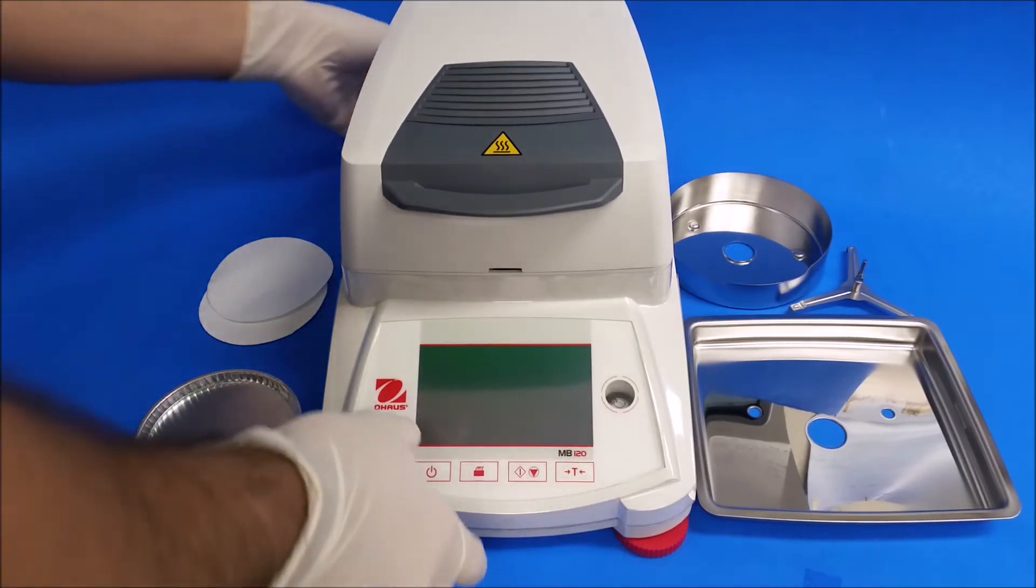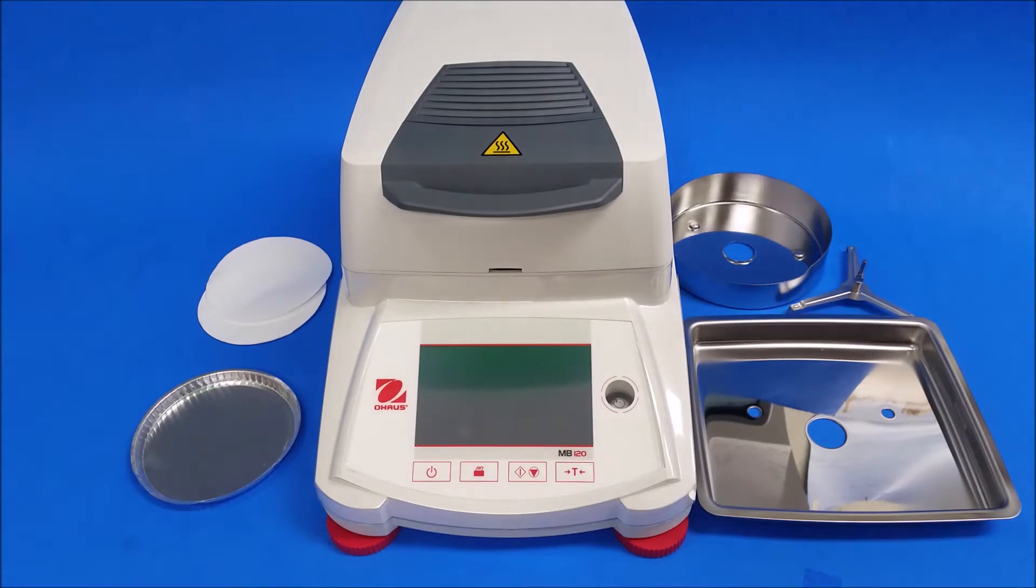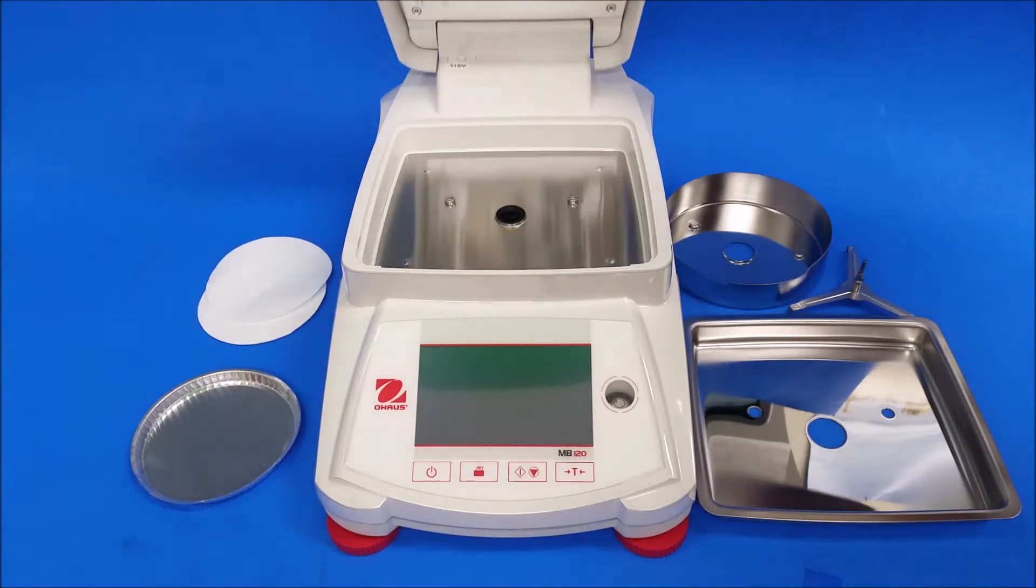First thing we're going to do is plug in the unit. The unit will turn on itself, so while the unit's loading up, we're going to start putting in the parts.